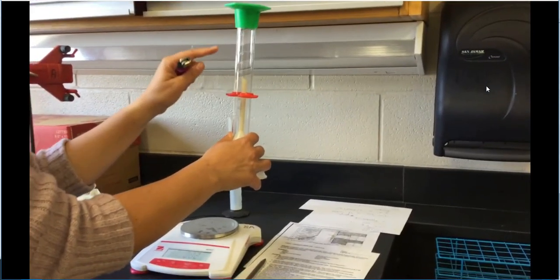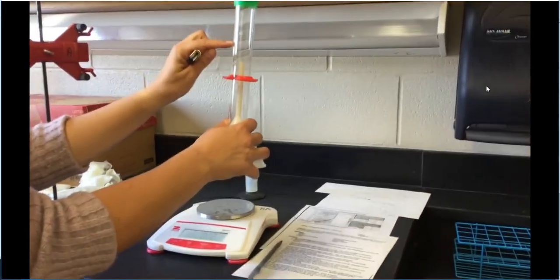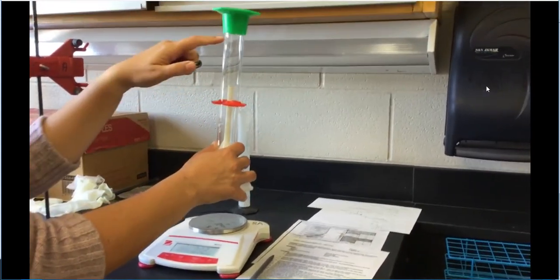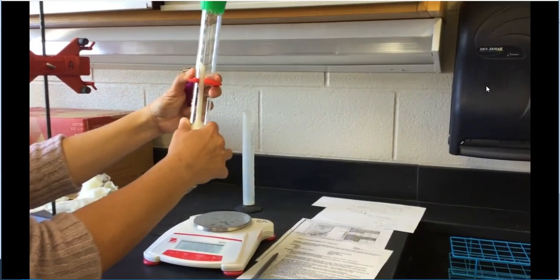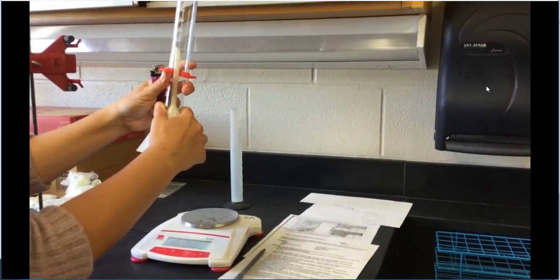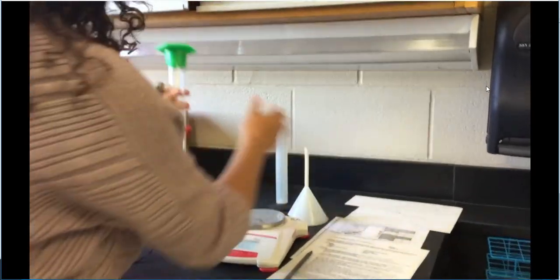And what we're going to do is we're going to watch that water level drop because basically all of the gas, it's matter, right? It replaces all of that water. And so we're going to want to get this down to right about here. We're going to be below the little red. So I'm actually going to move this right here so that we can see when we hit that. Okay? All right.